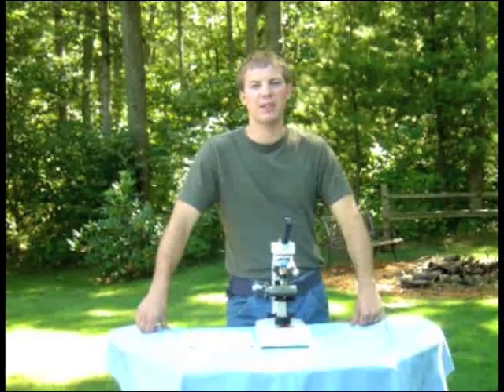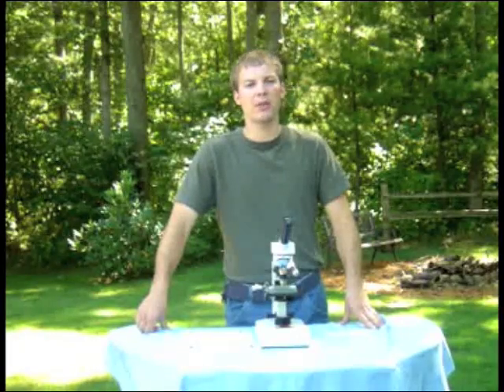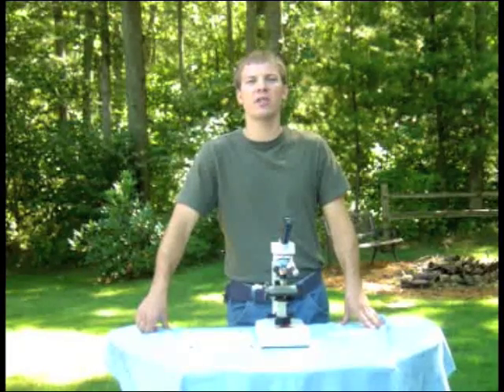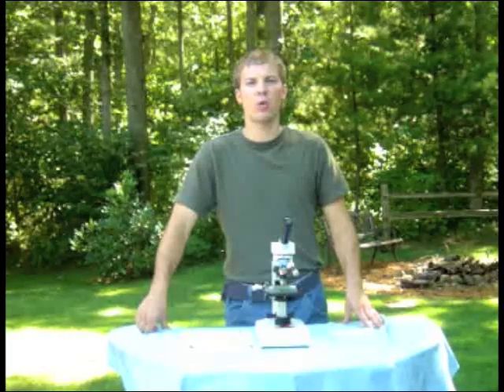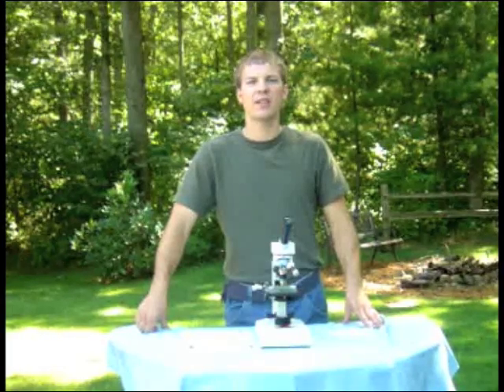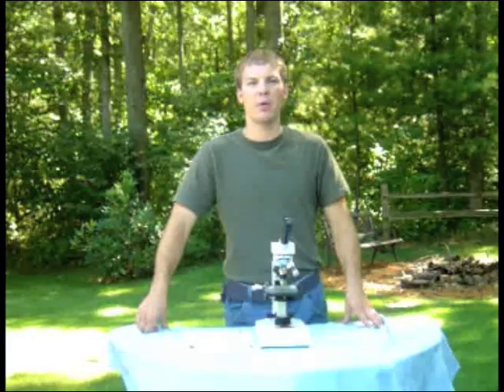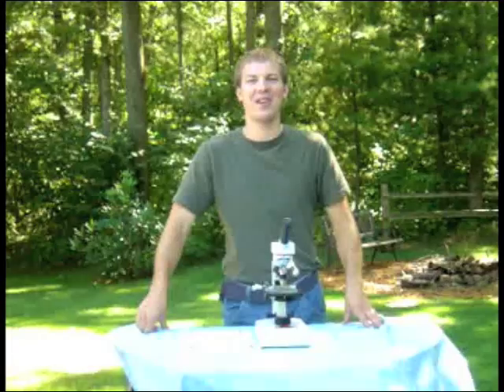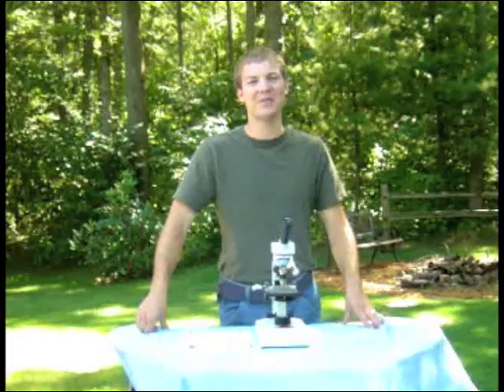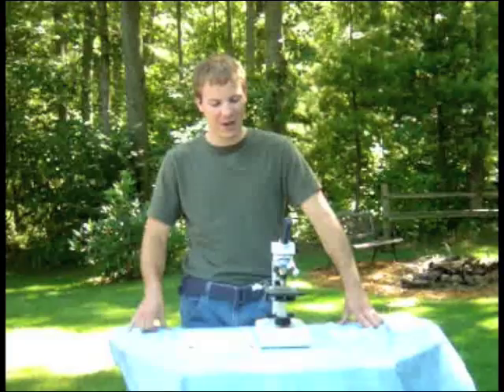I want to end by talking about some common mistakes that students make when using the microscope. I do this for two reasons: first, to make your experience with the microscope more enjoyable, and second, so I don't have to troubleshoot the same problems over and over again. So here are some common mistakes that students make.